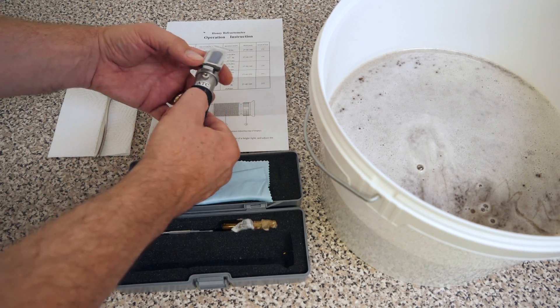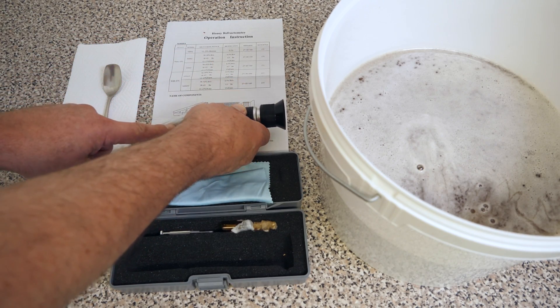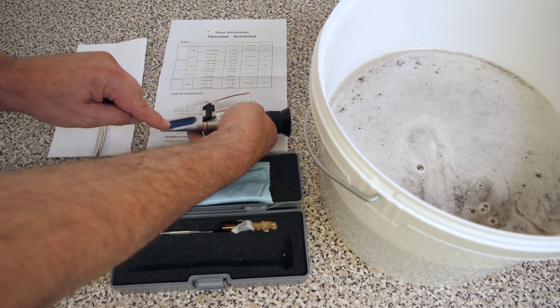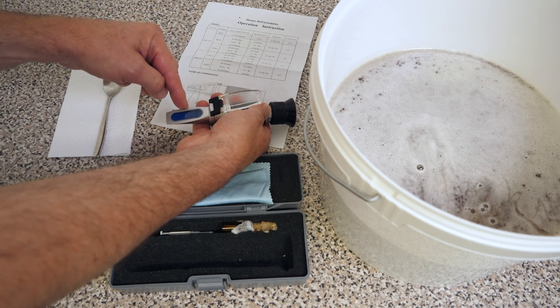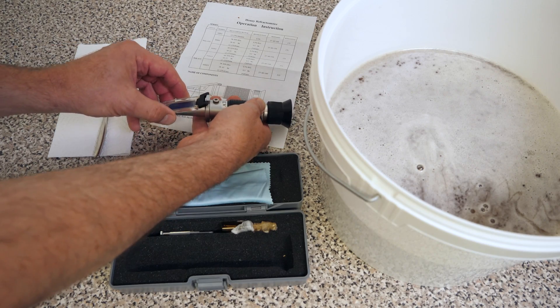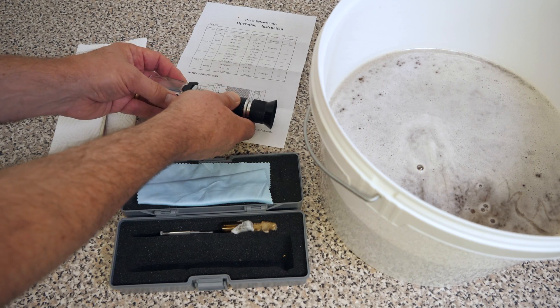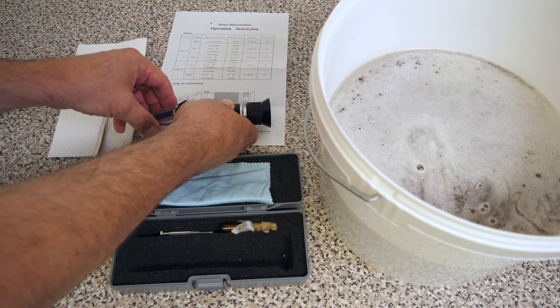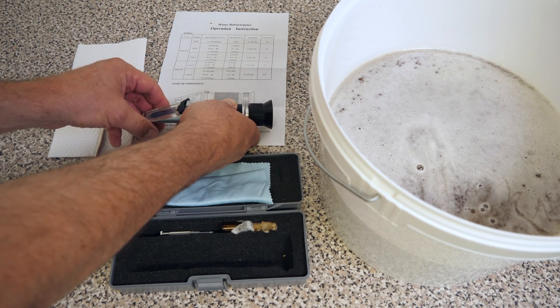Basically, what we have here is a tube with a prism at one end. We're going to place a sample of honey on this blue strip, then fold the cover plate down onto it, and then we can look through the eyepiece. That will show us the reading, and I'll put a clip of that reading in the video so that you can see exactly what water percentage we have.